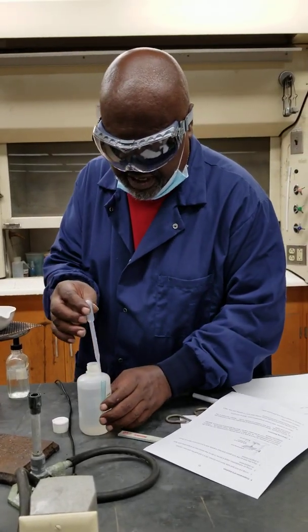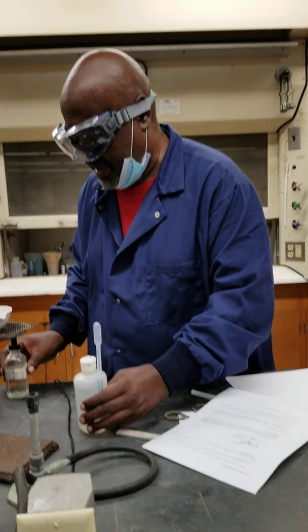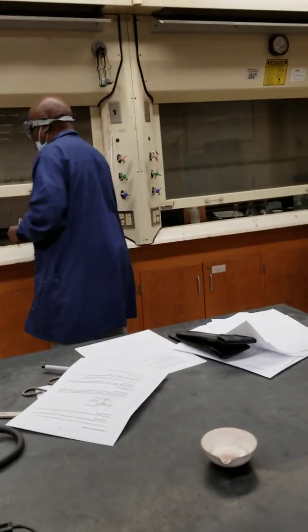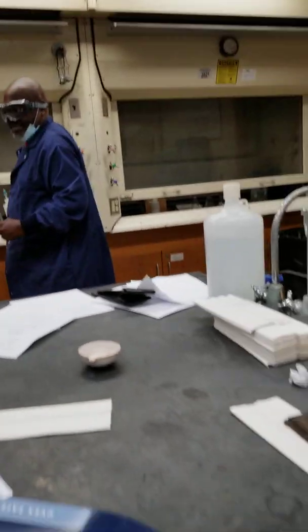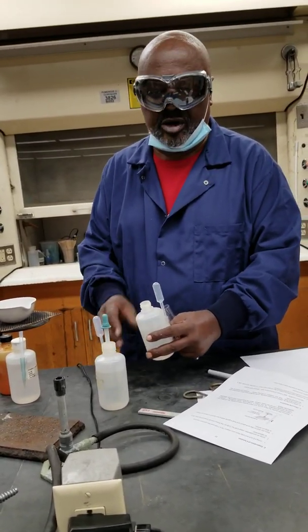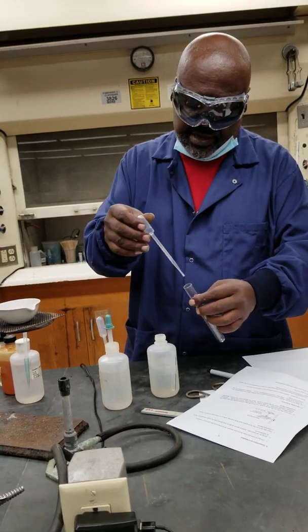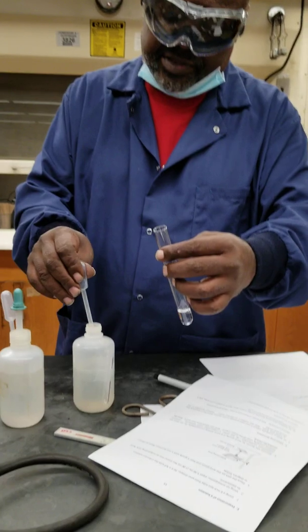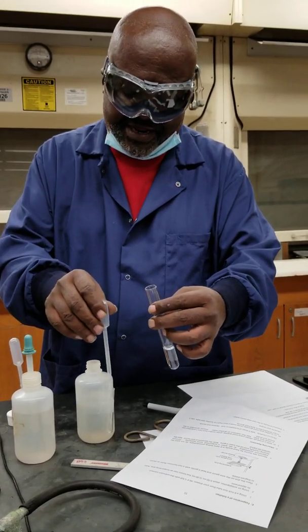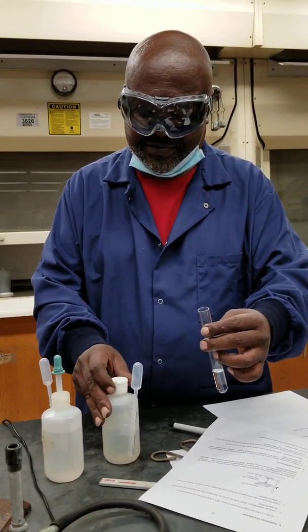One more to go. Make sure you retain things in the right location so that we don't get contamination. The last one asks us to consider or observe what happens when we take barium chloride — barium chloride aqueous, a solution of barium chloride in water. We'll get a bit of that — how about some more? A little more than I should have added, but hey, doesn't matter in this case. Just to avoid contamination, I close this before I put it away.